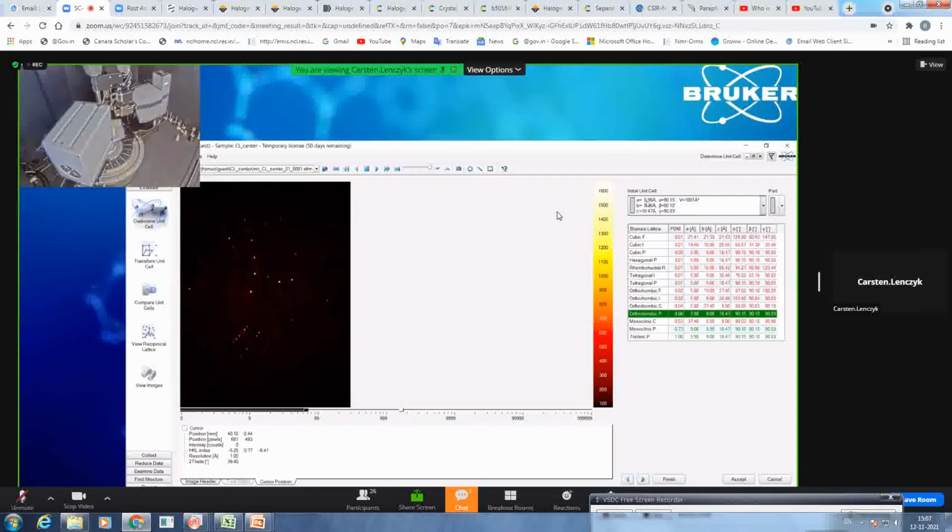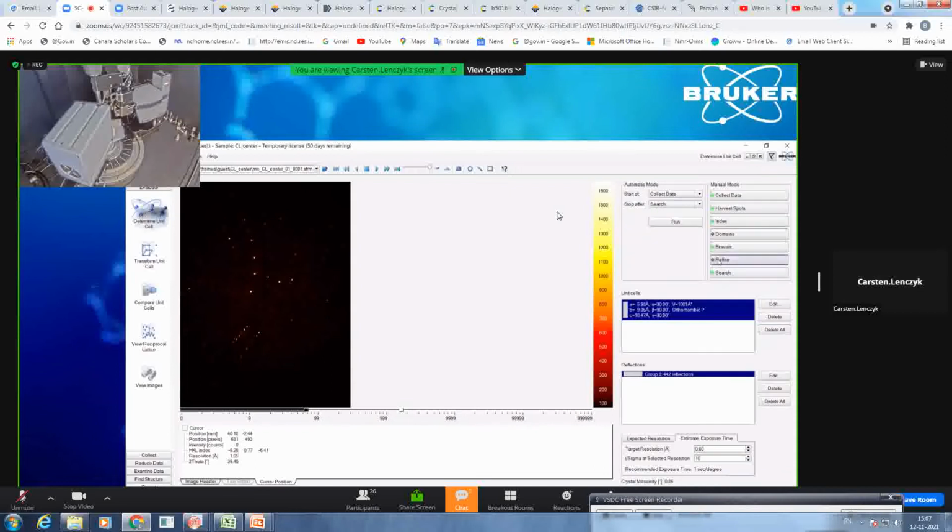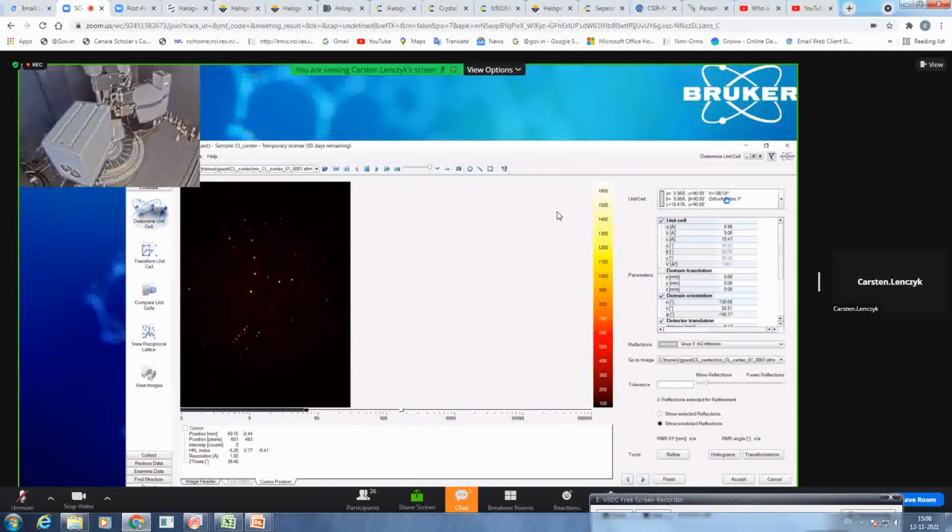So always check that the values are reasonable, and also the solution here. So overall, the angles are close to 90. That makes sense, and also the lengths are in a region and comparable to each other. So you are not 5, 9, 40, but 18, which is absolutely fine. So with that, we accept. We can refine if we want to once again. So it will now take also the Bravais into account. You can refine, and you will get now with the orthorhombic P the deviations, and you see they are even better than before.